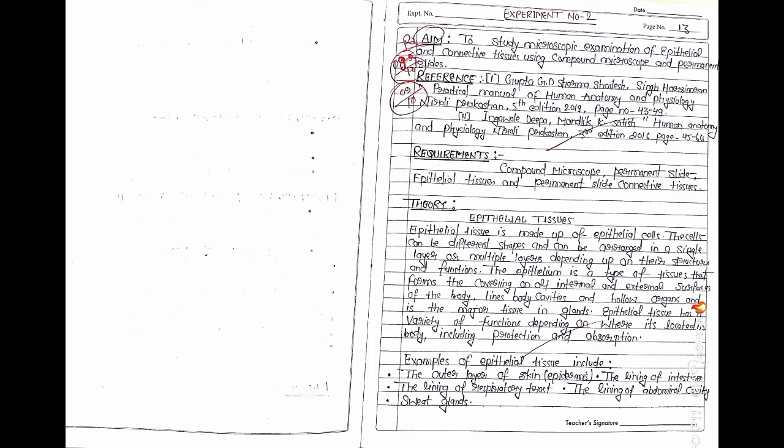Then we see the requirements: compound microscope, permanent slide of epithelial tissue, and permanent slide of connective tissue. These requirements are necessary when we are going to the lab for this practical.